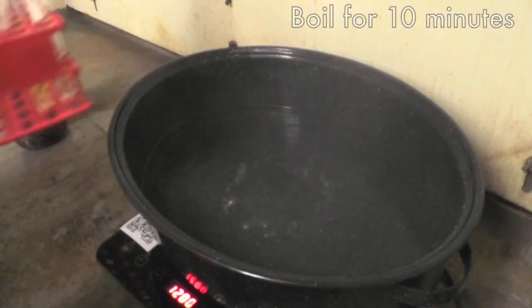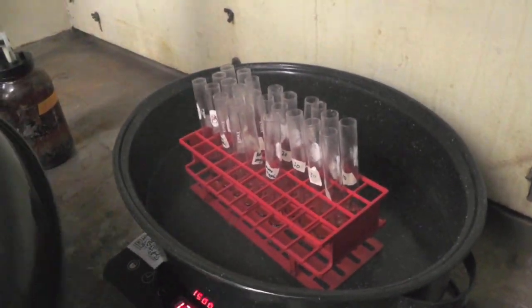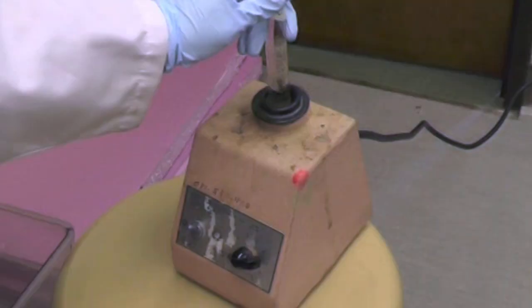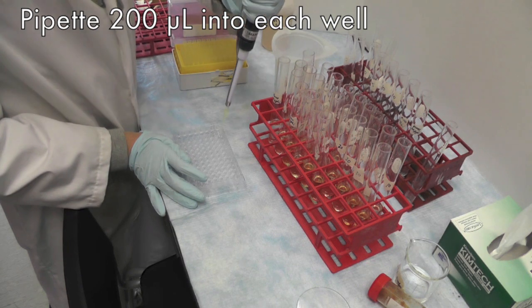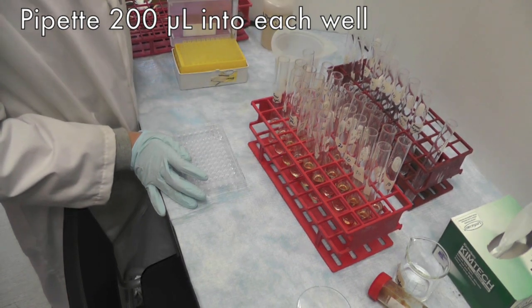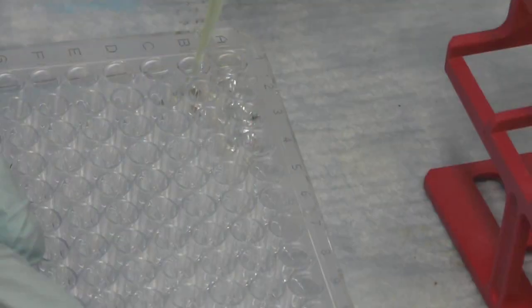Place the whole rack of test tubes into a boiling water bath for 10 minutes. After heating, cool the test tubes in an ice bath. Vortex each tube and pipette 200 microliters into the microplate. Record the location of each standard and sample in the microplate using the microplate templates provided on Connect.